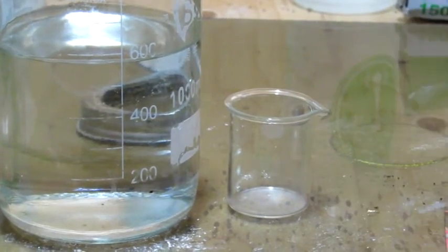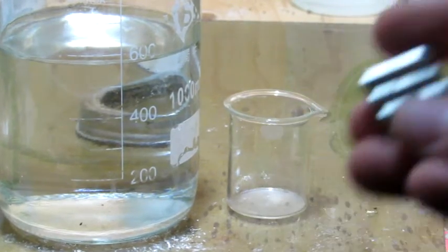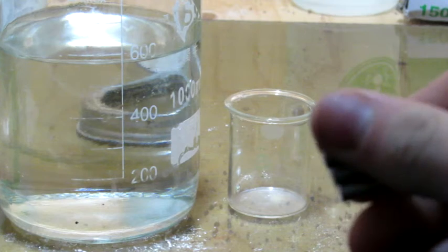Another excellent source of boron exists in neodymium rare earth magnets. These are an alloy of neodymium, iron, and boron, and then coated in nickel to prevent corrosion.